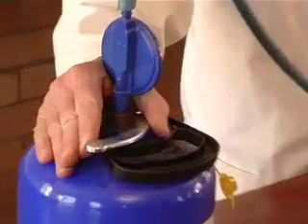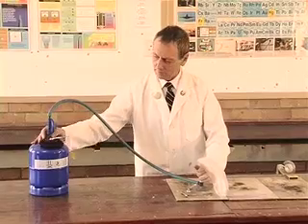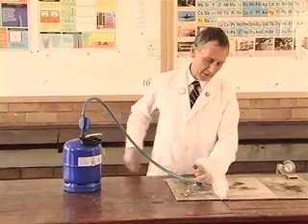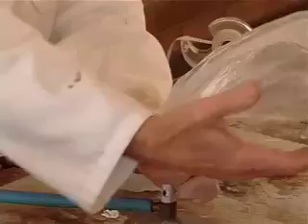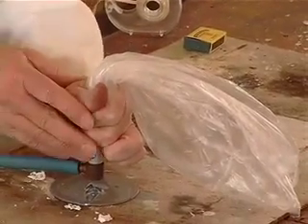Let's switch it on. The gas coming out of here is most probably butane or propane or a mixture, and you would be acquainted with the gas either from cooking on gas — some of you cook on gas.